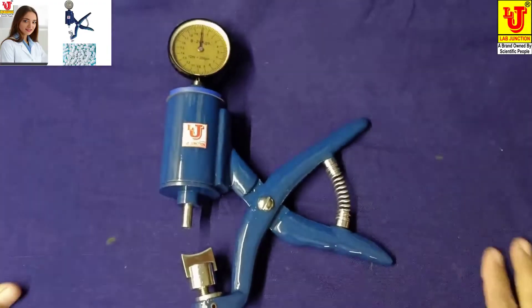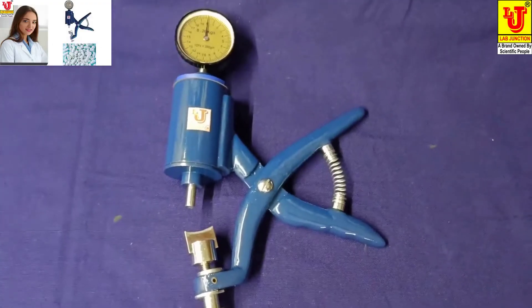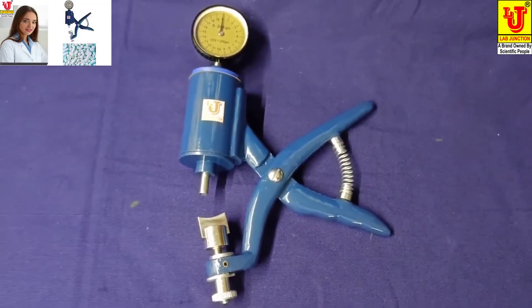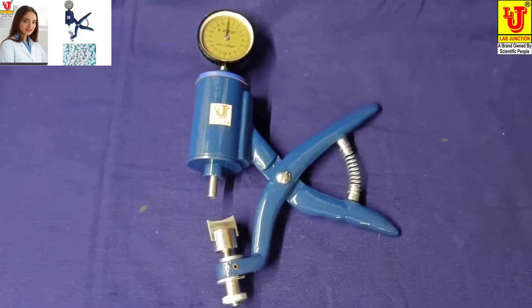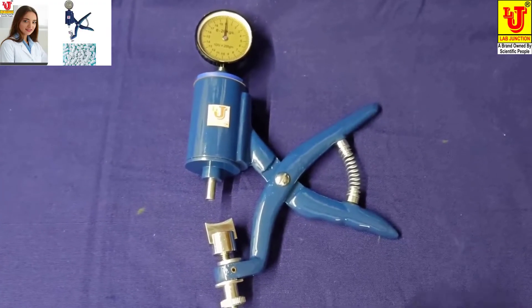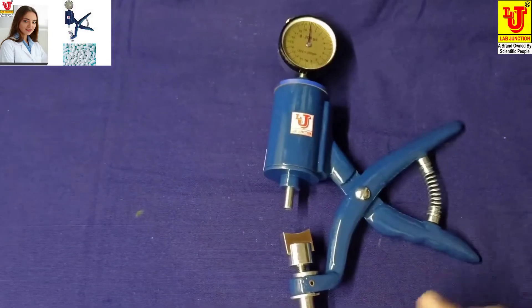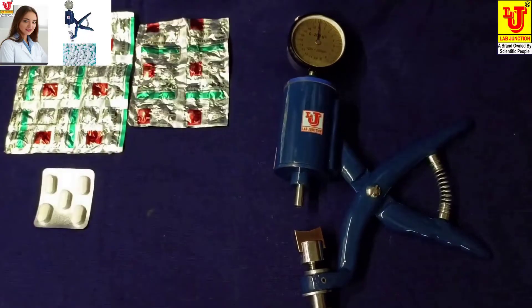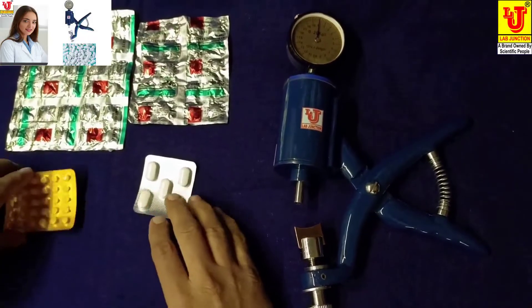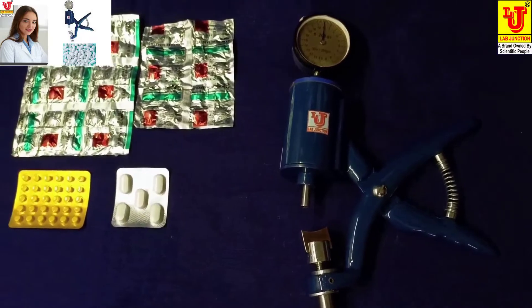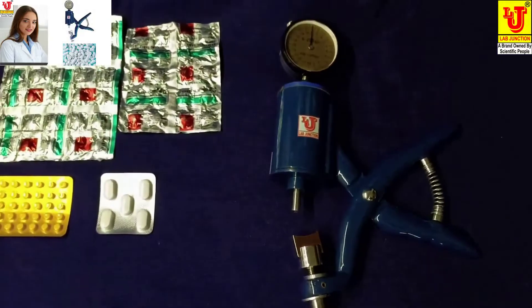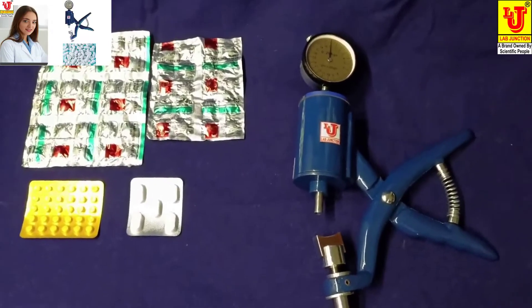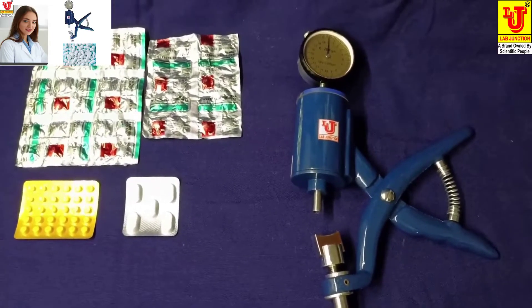Now, how to use this instrument - Pfizer type hardness tester. I have pharmaceutical tablet samples to test with this instrument.